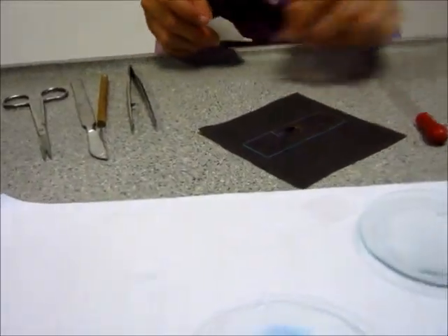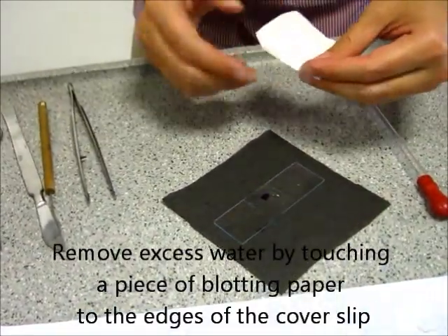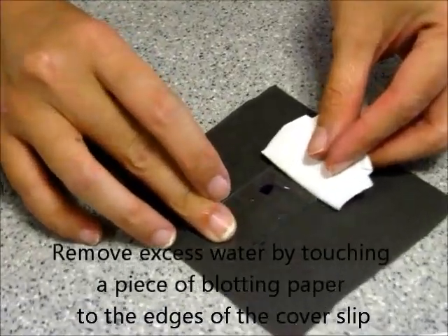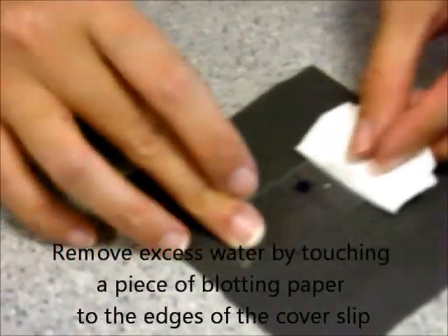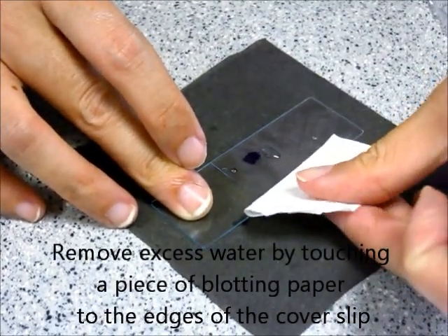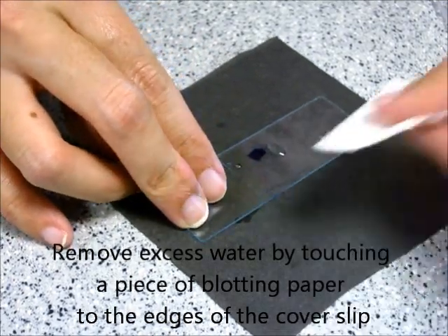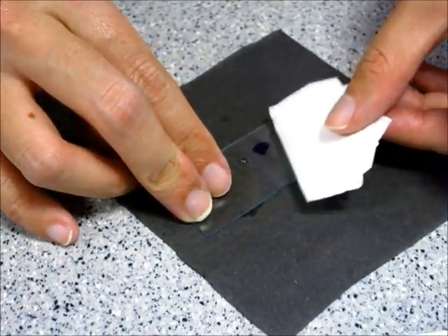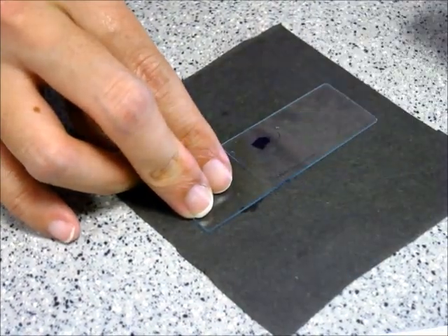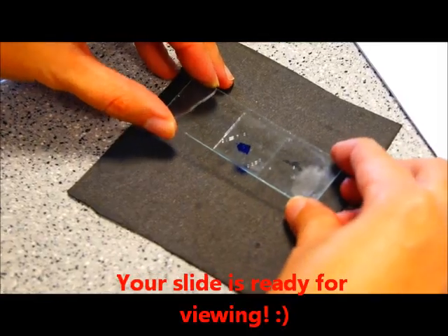We don't want to wet the microscope. So we'll need to use a small piece of blotting paper and just touch it to the edge of the cover slip. And the excess water will automatically get absorbed. Touch it to the other side also. See that the excess water is now almost all gone. Let's touch it to the top. Don't hold it there too long. If not, it will absorb all the water. And ta-da! Now that we have a sample ready for you.